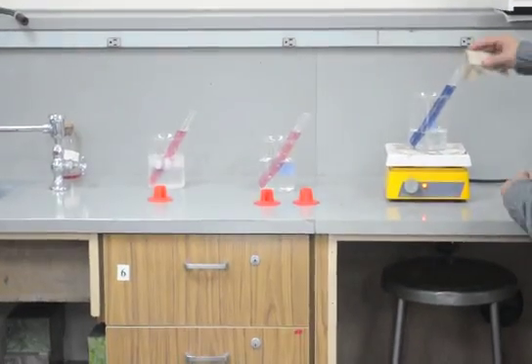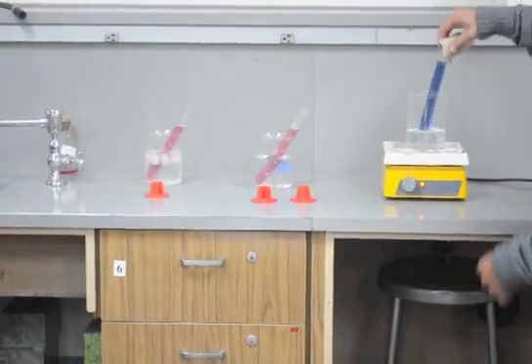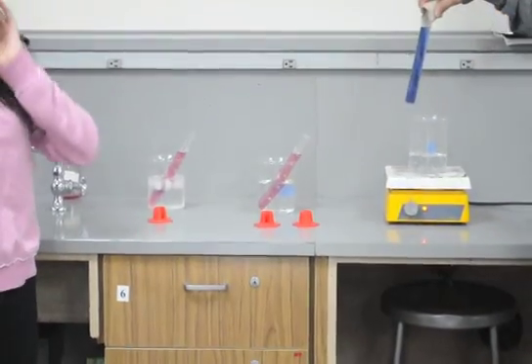And now, Chate, you pick out the other two and bring them over, and let's put them together so we can compare those colors.